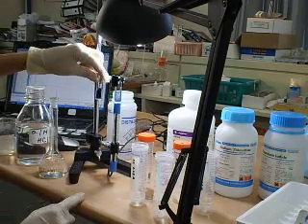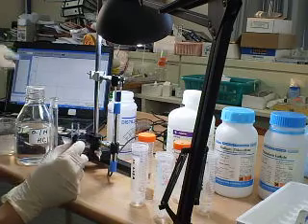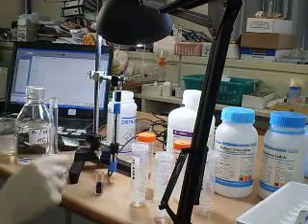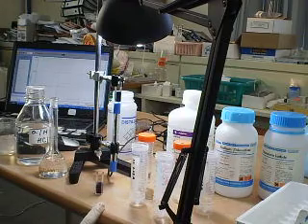It starts to form. Once it's formed, light intensity will drop and we take the time it takes for the light intensity to drop. It's an alternative way instead of using the cross method. Thank you.